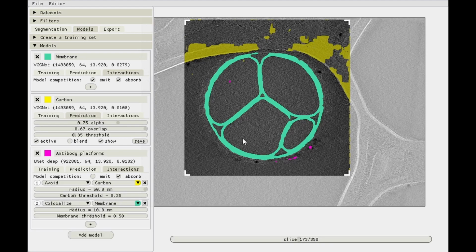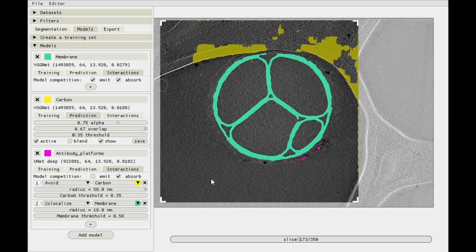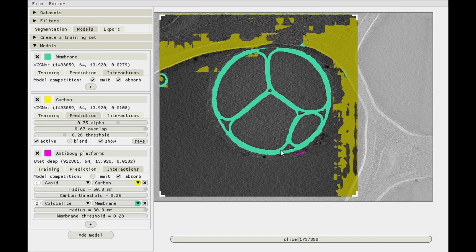Let's add another interaction to fix a problem that we actually don't have right now. But let's say there would be an antibody prediction over here in the bottom somewhere where there really shouldn't be one. We can get rid of it by saying antibodies need to co-localize with the membrane, which they should, right? So again, let's set a fairly big radius to not be too strict, and then set the threshold to, radius of 30. Right, this one is back again, but let's ignore it for now. And then the membrane threshold, set it a little bit lower. There we go. See if we can get rid of this, maybe by lowering the carbon threshold a bit further. Fine. Yeah, that seems reasonable.